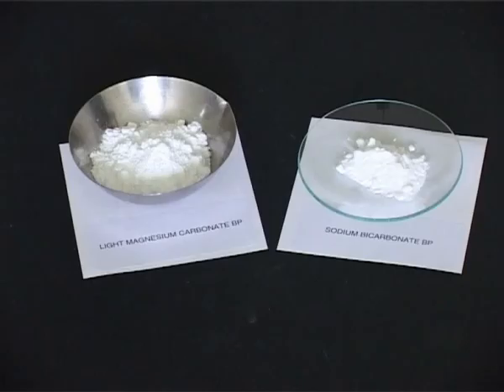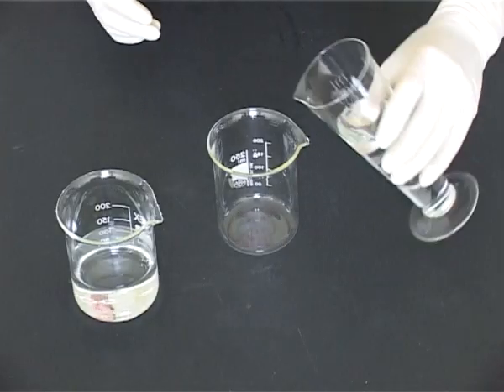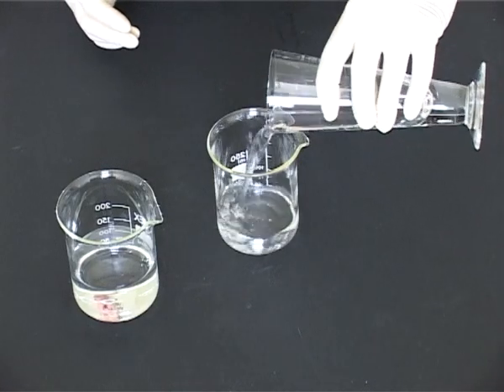When preparing a diffusible suspension, weigh all solid ingredients and check their solubility. Pre-measure any liquid ingredients using the smallest possible measure and pre-prepare any double-strength chloroform water required. Choose an appropriate container in which to dissolve any soluble solids.